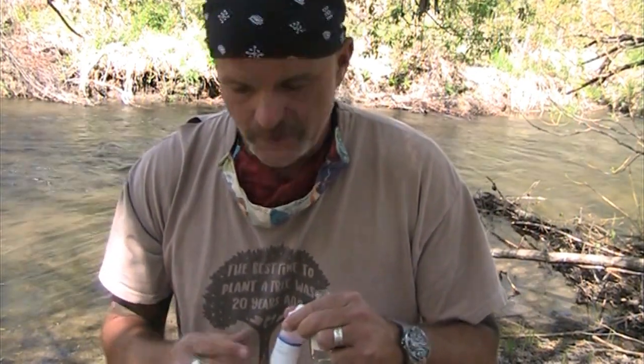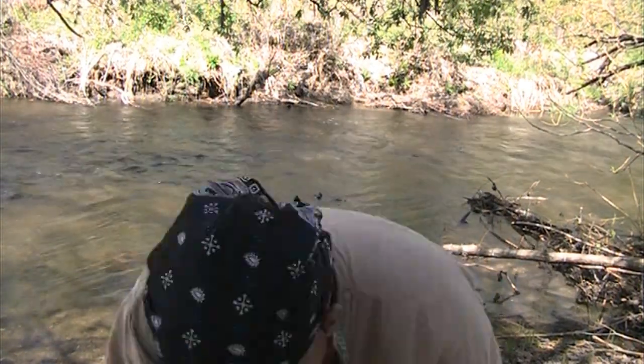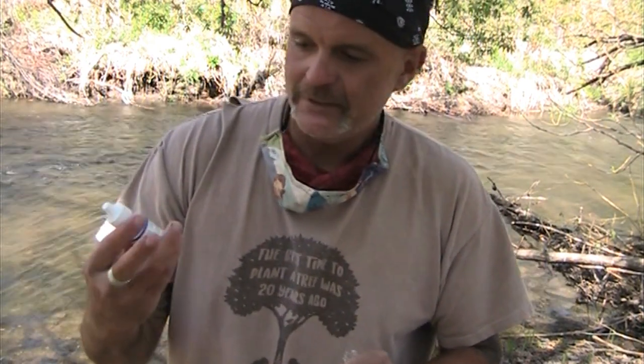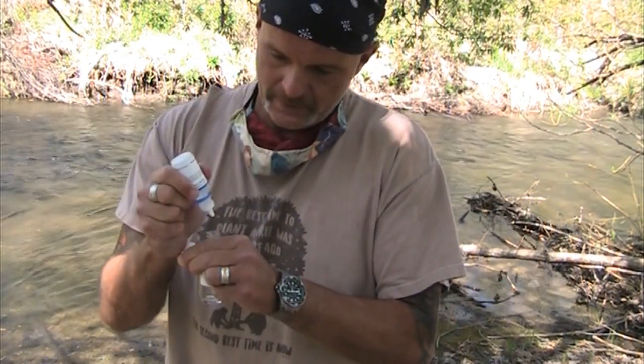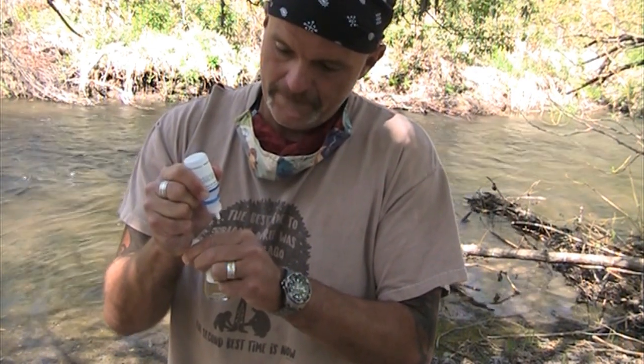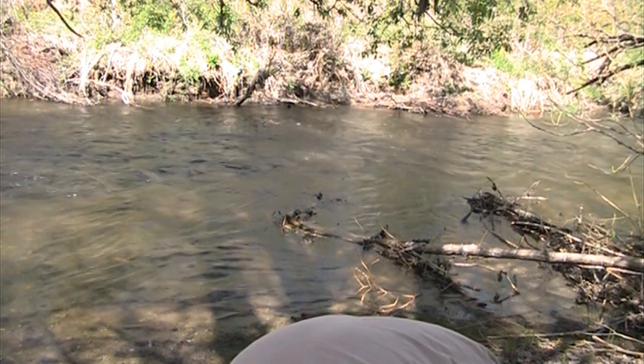As soon as I put in the drops, you're going to have to tell them, do not shake the bottle, because the bad scientist in all of us wants to shake the bottle. Instead, you're going to go get the next bottle. It's got an awesome pirate on it, which means it's a bad chemical. It's alkaline potassium iodide with azide. Again, you're going to add 8 drops. 1, 2, 3, 4, 5, 6, 7, 8. So I've added my 8 drops of alkaline potassium iodide azide.